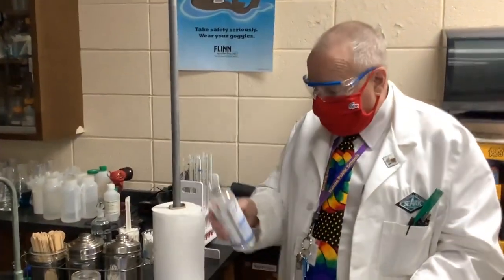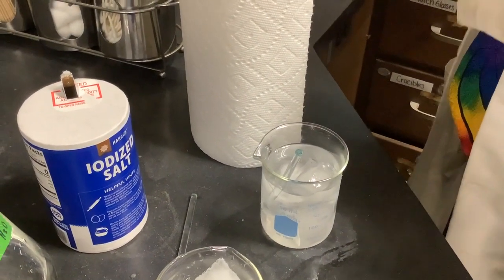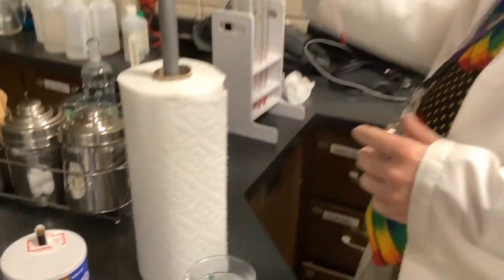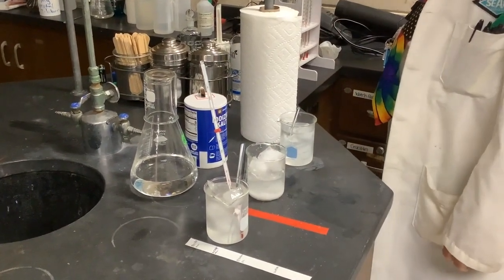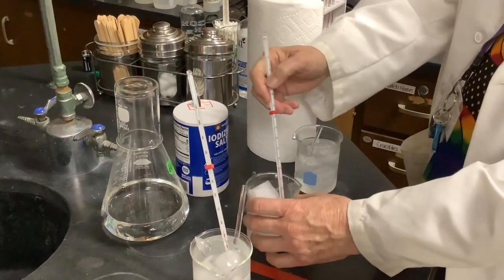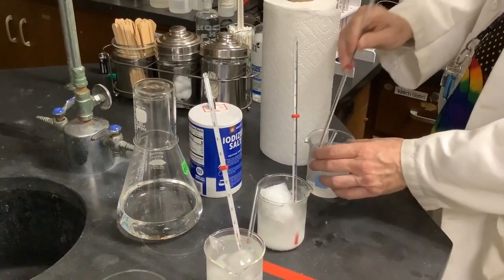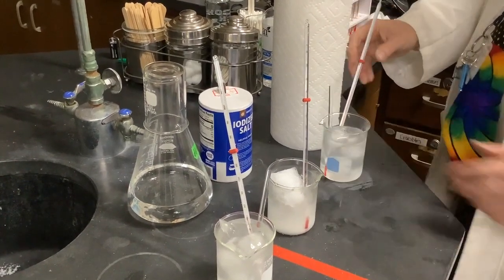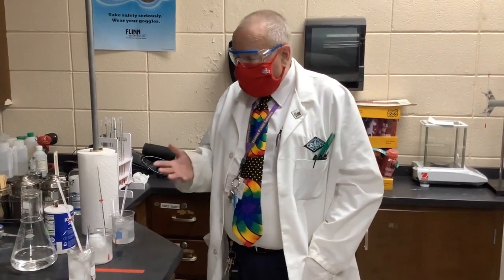And this is just some alcohol. I'm going to pour it over the ice. And then here in a minute, we're going to measure the temperature. Now, if I measure the temperature, I'm going to take several of our thermometers. They're beautiful red alcohol thermometers. I'm going to let them equilibrate with these systems. And we're going to look at these temperatures that we're reaching when we set up the thermometers with these different combinations. And this speaks to the high heat capacity of ice. It speaks to the latent heat of melting. Phase transitions are accompanied by thermodynamic changes, and we're measuring that as well.